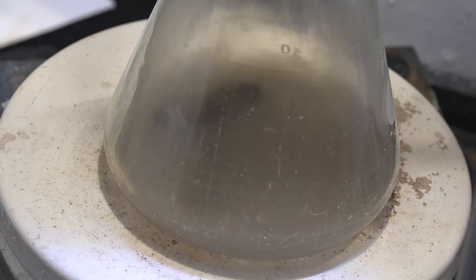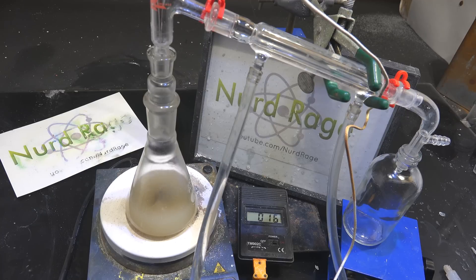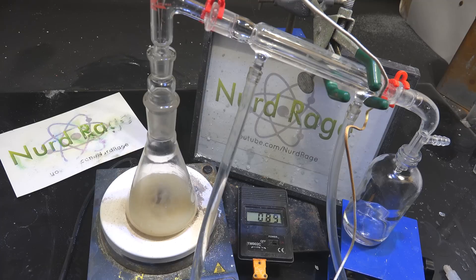So let's distill it. Transfer the triethylamine to a flask and set up a distillation apparatus around it. Turn on the cooling water and the heating and gently distill it over. By converting all those impurities into non-volatile sludge, we can leave them behind. I didn't put the sodium piece in the boiling flask since the reaction was already done. But if you're pressed for time and don't want to wait the few days, a fast method is to simply reflux everything with the sodium for a few hours, then distill over. You can be done in one afternoon.